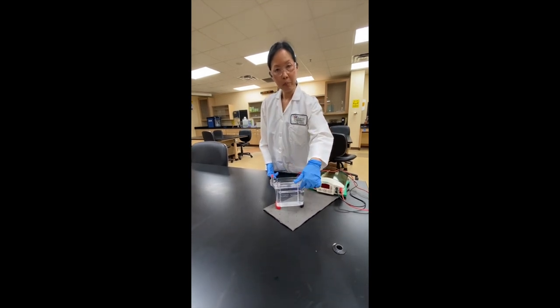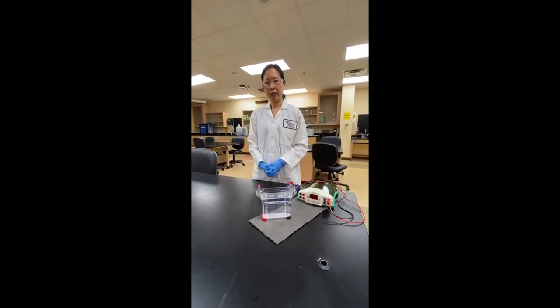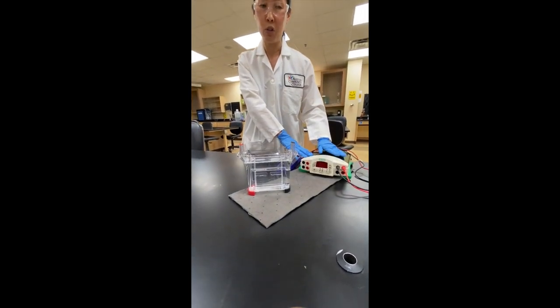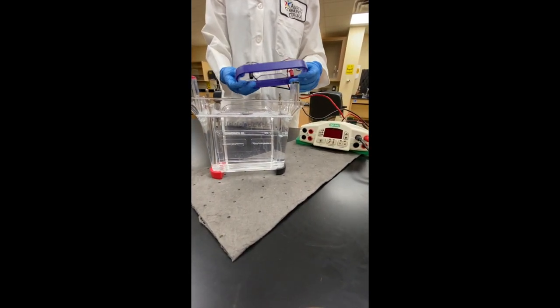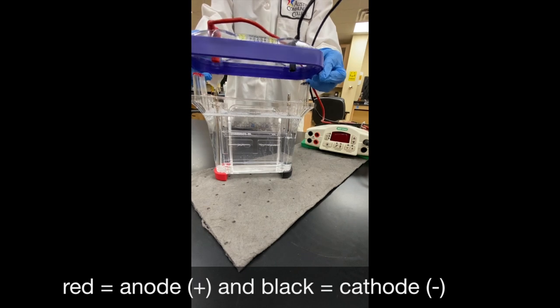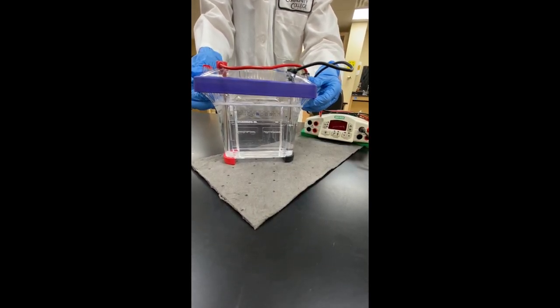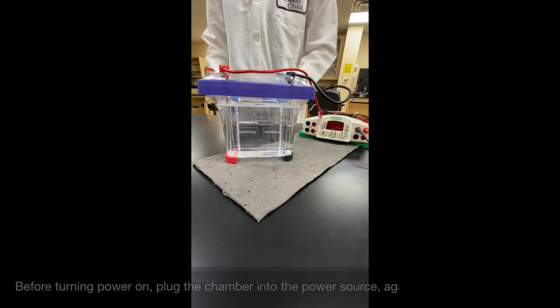We've loaded all samples into the wells one by one, changing tips every time. Now we're ready to start electrophoresis. Make sure the electrophoresis chamber is near the power source. Put the lid on the chamber, matching colors: the red lead goes to the red anode side, and the black lead goes to the black cathode side. Then gently press evenly on both sides to make sure the cover is properly seated.